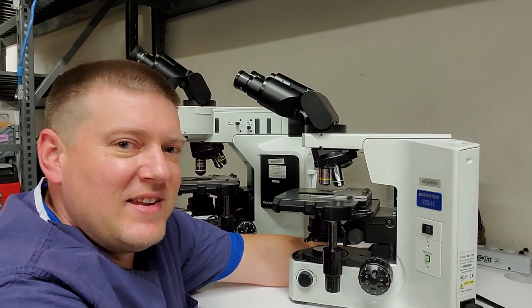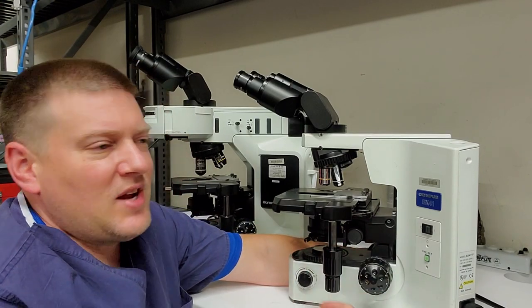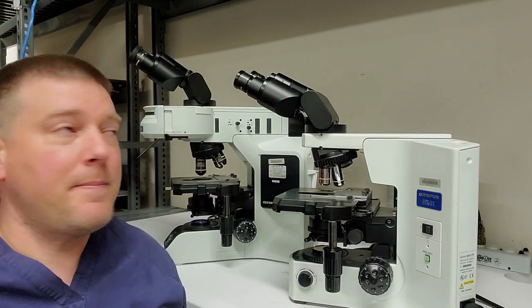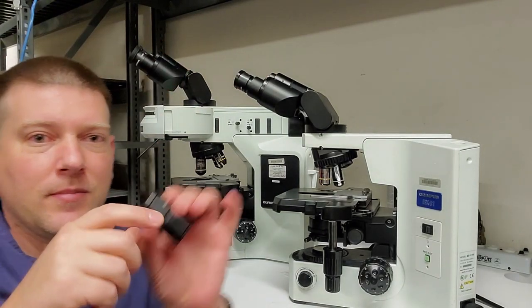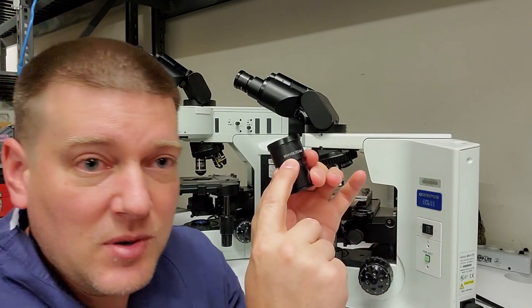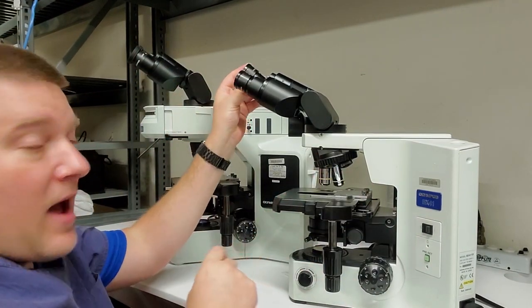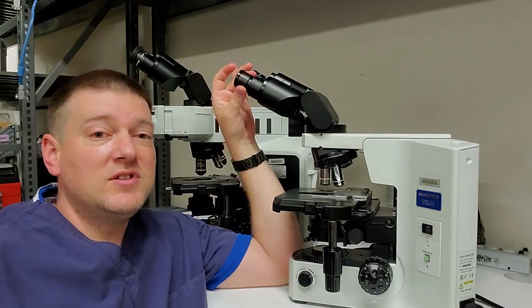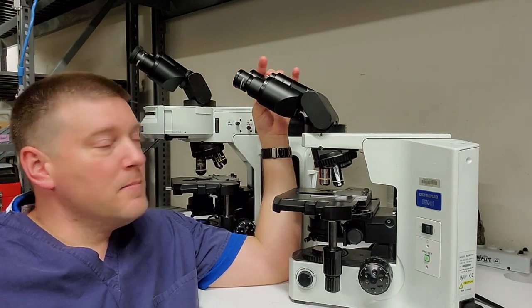So let's go over some of the details of these guys, so that I can continue talking to you guys and you understand what all the components are, all right? We're gonna start at the very tippity top up there. What we have up here are things called oculars. And your oculars are going to have an inscription on the side, which is their magnification. Now, on laboratory microscopes, usually what you will have is one stationary ocular, and one that moves.